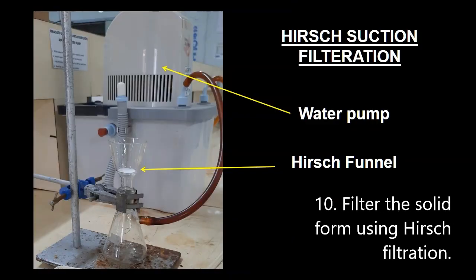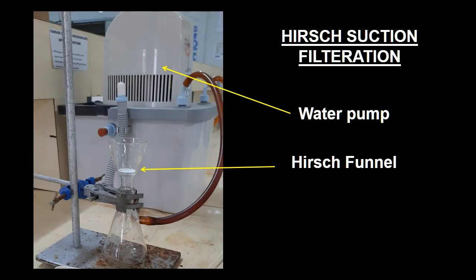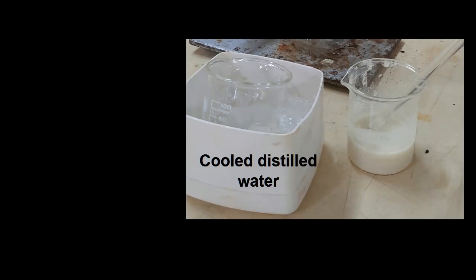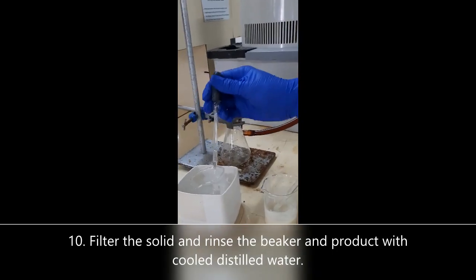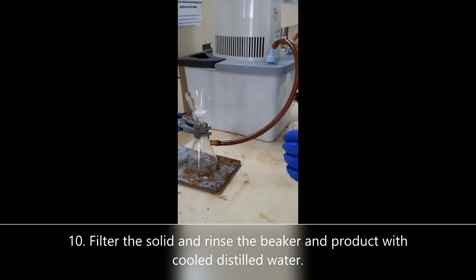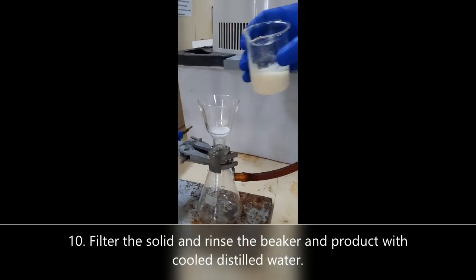For the vacuum filtration step, a water pump is fixed to the conical flask attached to the bottom of the Hirsch funnel. Cold distilled water is used to rinse the solid. Pay attention to the technique being shown in the video. First, wet the filter paper with a small amount of cold distilled water, then pour the precipitate into the Hirsch funnel.